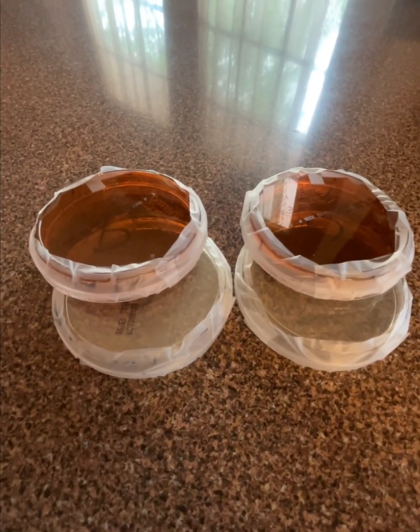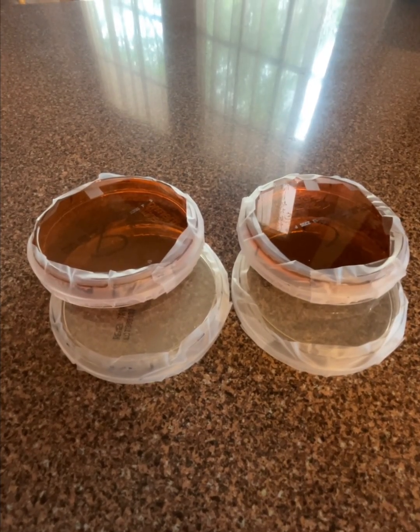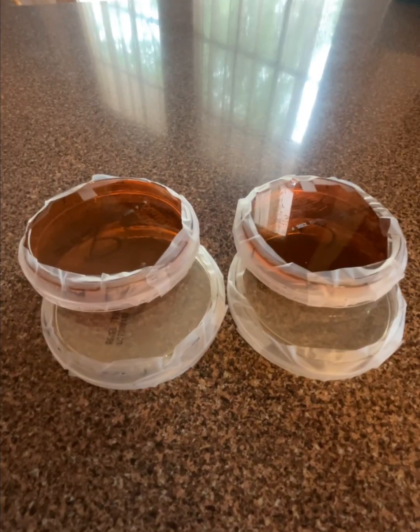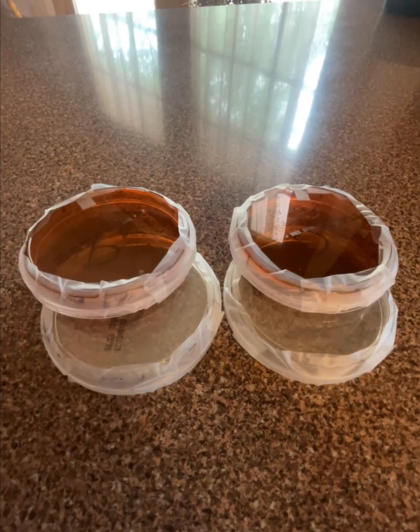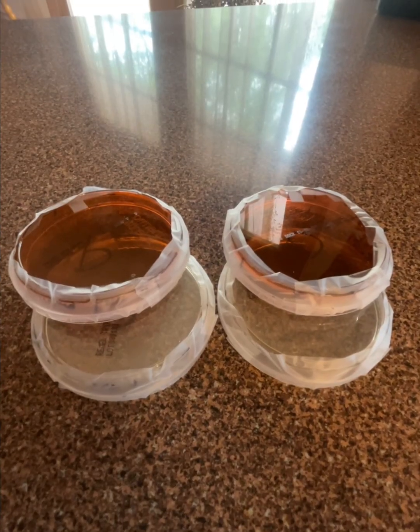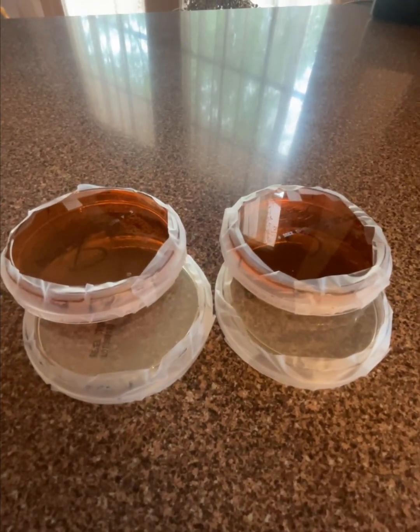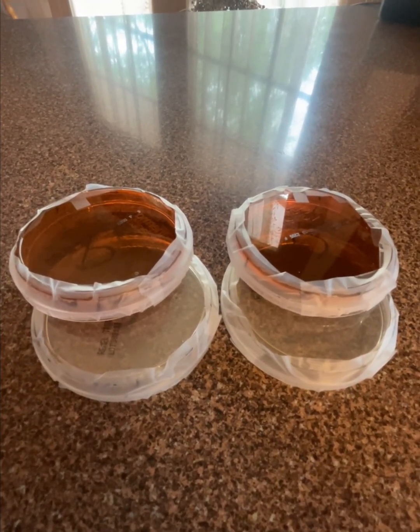After completing both treatments, I had 4 agar plates ready for incubation. My boiled sample was streaked onto 1 TSA agar plate and 1 EMB agar plate. My alcohol treated sample was streaked onto 1 TSA agar plate and 1 EMB plate. Each plate was clearly labeled with the treatment type, date, time, my initials, and the plates will now be incubated at room temperature, and they will be checked at 24 hours and 48 hours, and I will evaluate the bacterial growth at both. My control samples are already done, and I will add those into the results at the end.